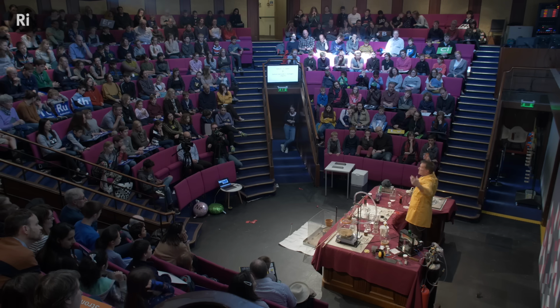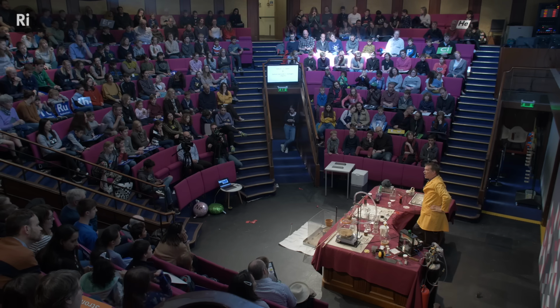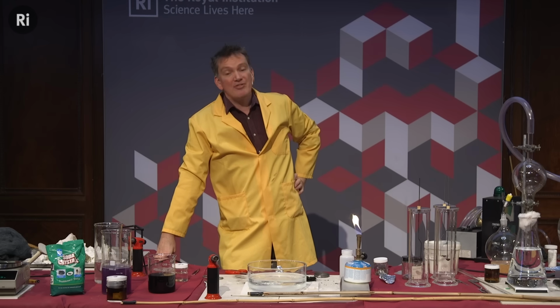What's happening during the chemical reaction is the sodium, remember that outermost one electron that was whizzing around with all of our group 1? That electron is easily lost. And if an atom loses its electron, it becomes positively charged. And what happens here? The charge on our molten sodium is becoming more and more positive, and of course we know that like charges repel each other, and so when the charge builds up too much, it pings apart. It's called a Coulombic explosion or a charge explosion. That's the reason that we get the bang there.